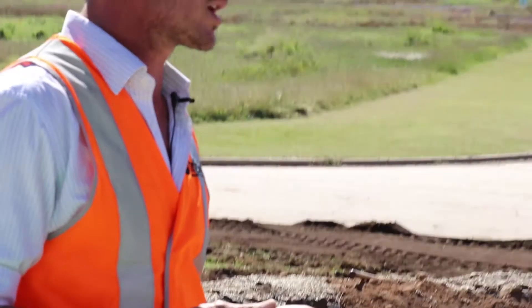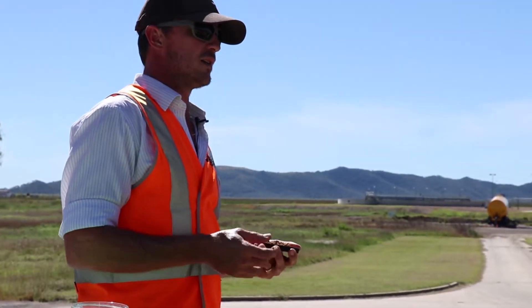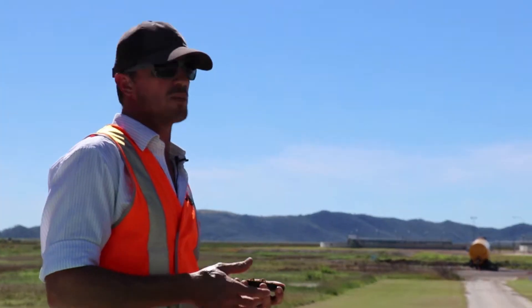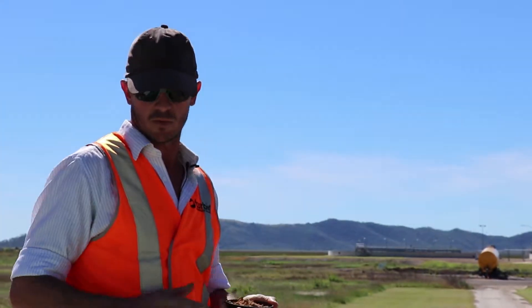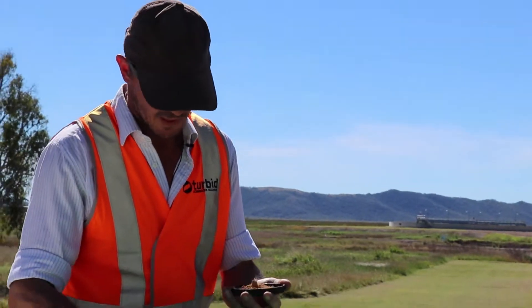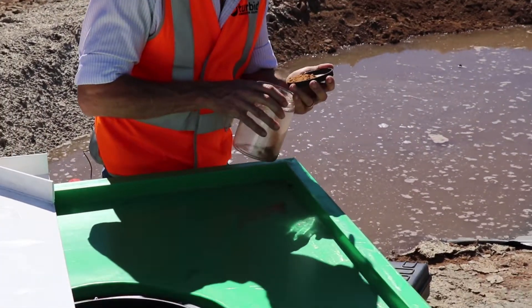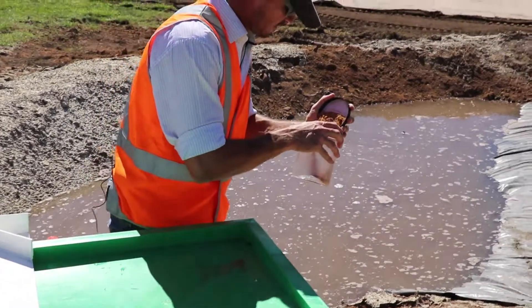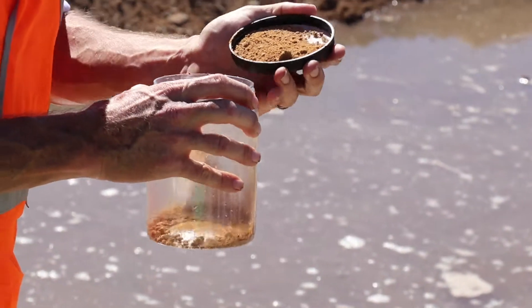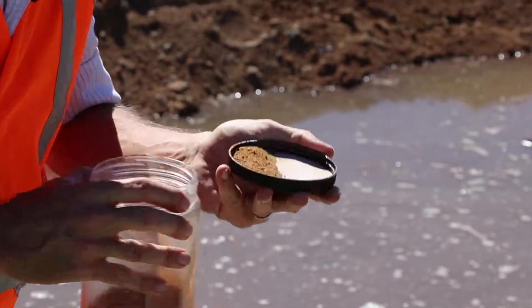So we'll either crush and then put it through a sieve — like a one millimetre sieve — and then measure that out, putting in about 10,000 milligrams per litre. But for today we're not going to do that; I'm just going to throw some soil in.